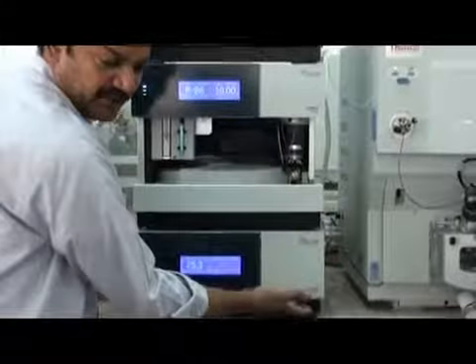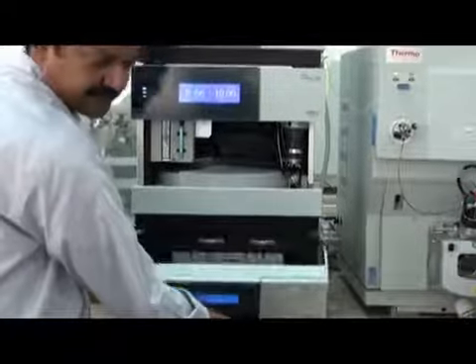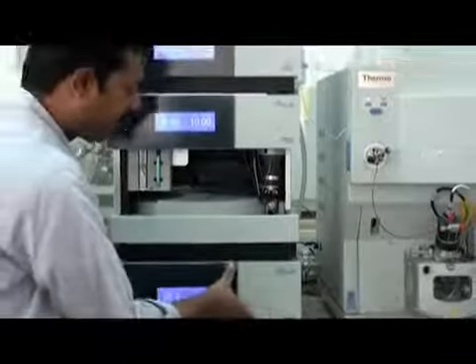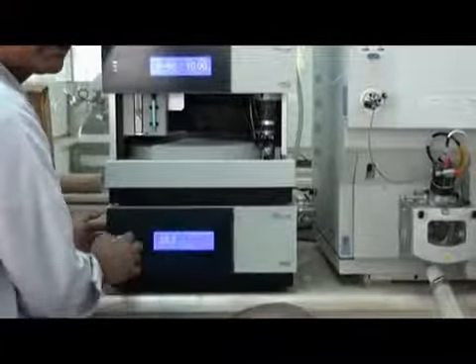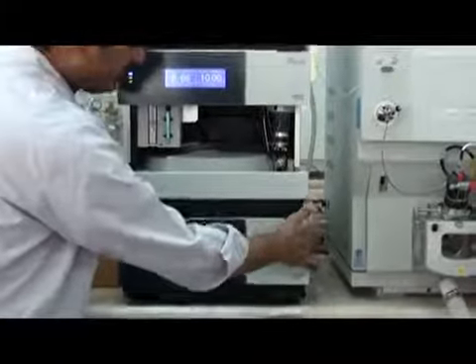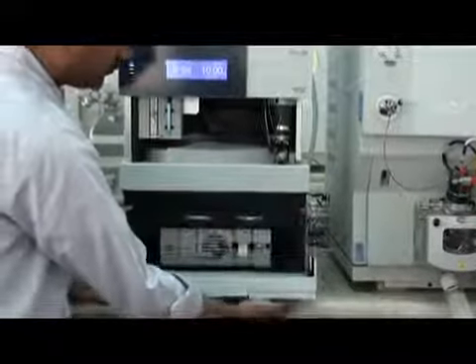So you have to lift it from here, just lift it like this, and then you can open. Okay, make sure. Now it is not locked. I will push it a little. Now it's locked, because it's temperature controlled, so it's more packed, more closed. Now you cannot open it. If you pull it, it will not open. So always take care: just pull it from here and then you can open it.